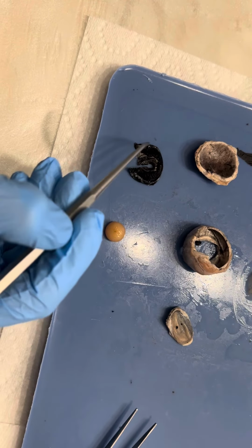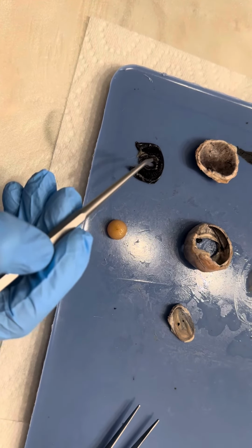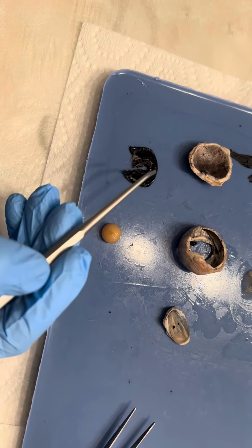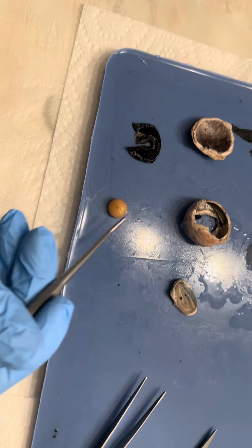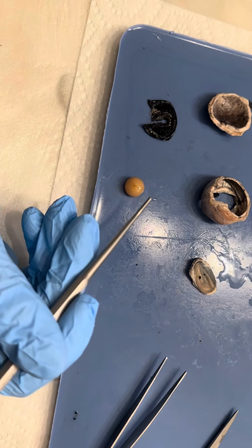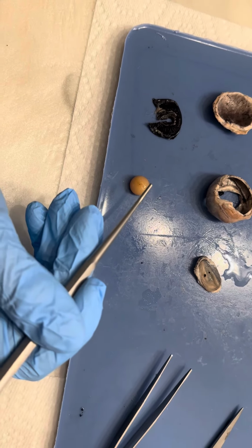Also near the choroid layer are ligaments that suspend the lens and stretch it to focus vision. These ligaments are called the zonula ciliaris. And over here is our lens. So the lens, that's going to help focus the light coming through the cornea and the pupil.